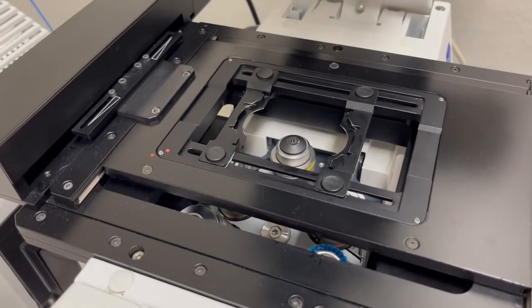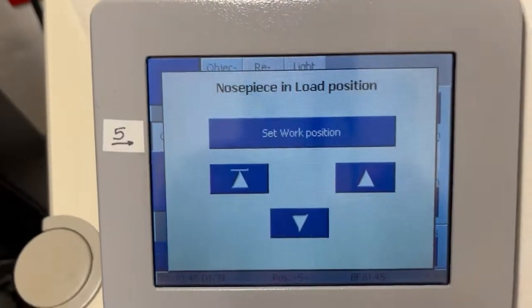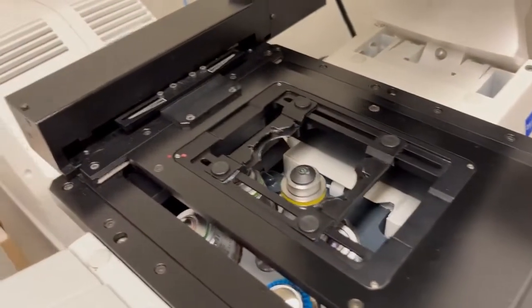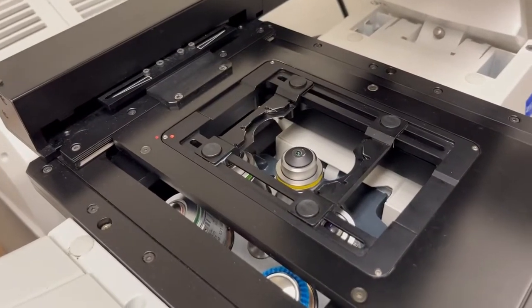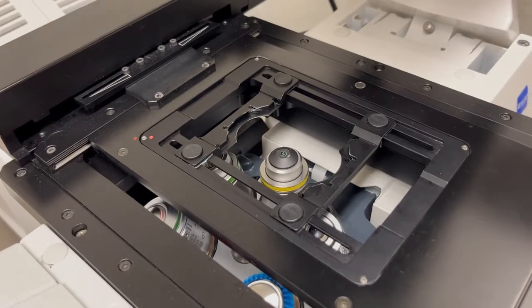Because we had lowered the objective, we can now raise the objective back to the working position on the touchscreen by pressing not the biggest button, but the one with the triangle and the line. If you press that, the objective, you heard a little noise, it went right back up to the working position, which is closer to where the sample would be in focus.